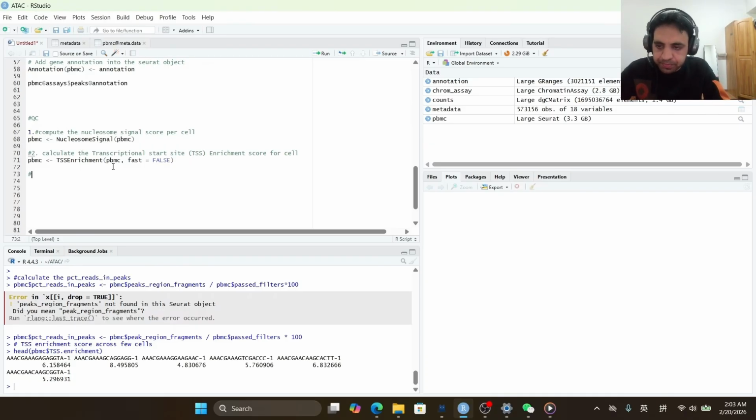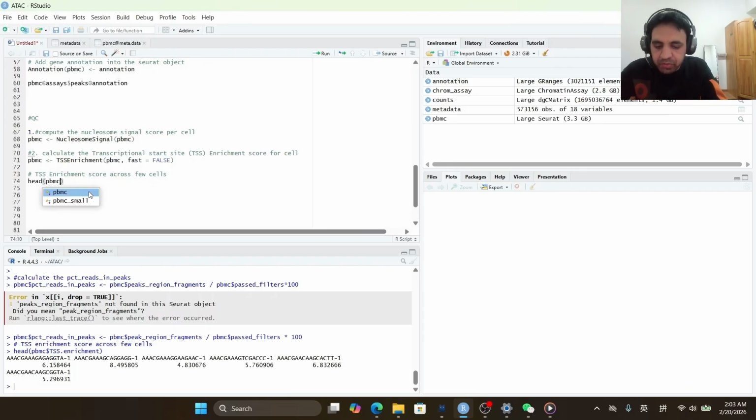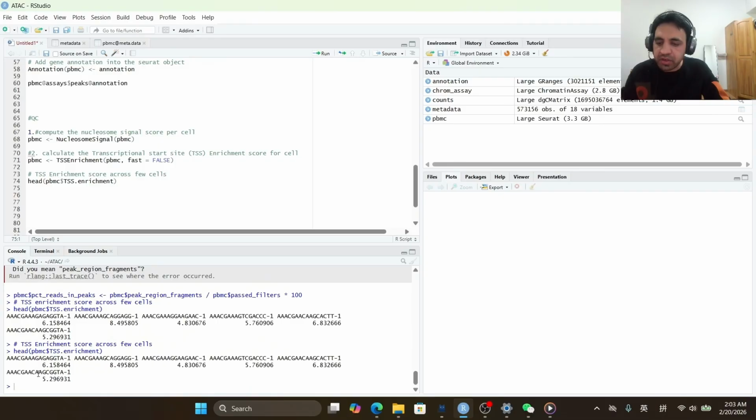So TSS enrichment score across a few cells. So we will use the head function, PBMC, and then we will access the TSS enrichment slot and run. You can see the TSS enrichment score has been given for a few barcodes or cells, and now we will visualize the peak region fragments. So we will make a violin plot.